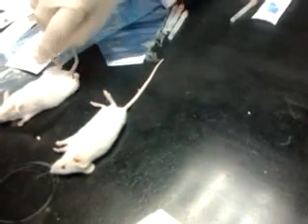So this one already has the tongue out, so you won't get choking. Okay, you pinch and see. Not like just now, very painful. No, less pain. You want to try? You pinch and see, compare that one. Compare this, you can see the limbs all moving. And compare this one. Less, but they can still move.